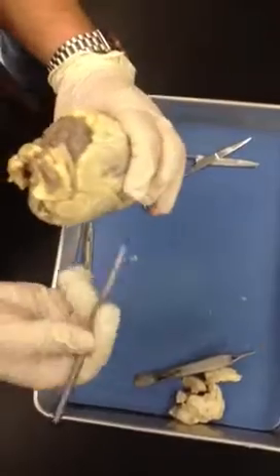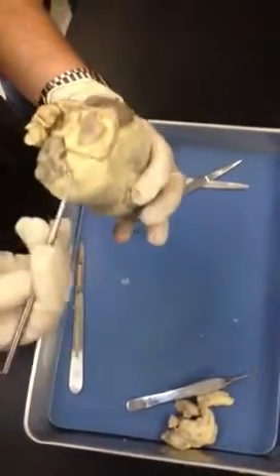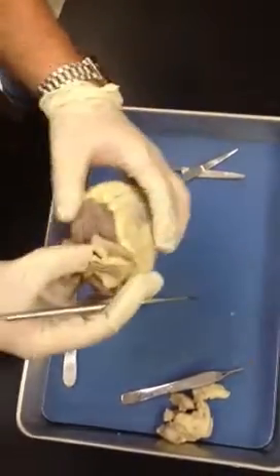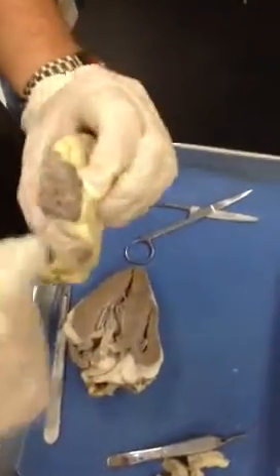This is the sheep heart. If we look at the front of the sheep heart, we know it's the anterior because right here are the auricles. It's the left auricle, and this is the right auricle. They face forward, which means in between them we're going to see the pulmonary trunk, right in between the two auricles.